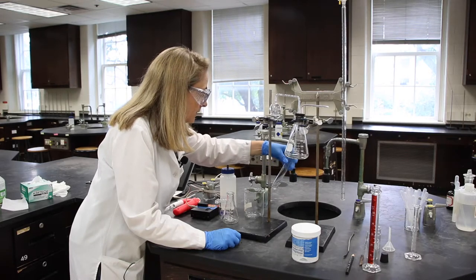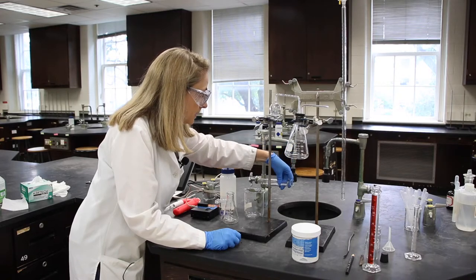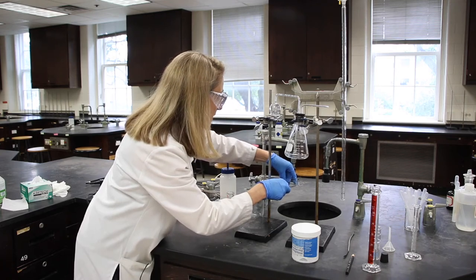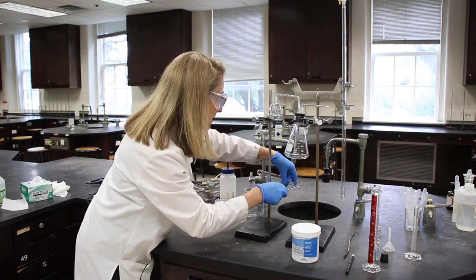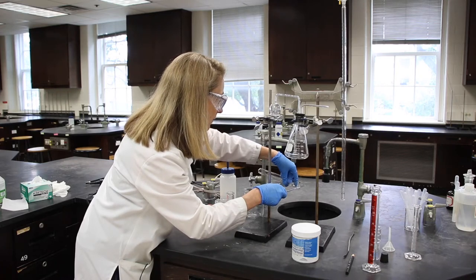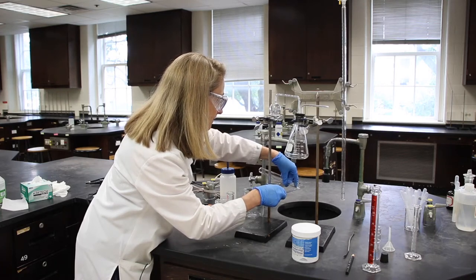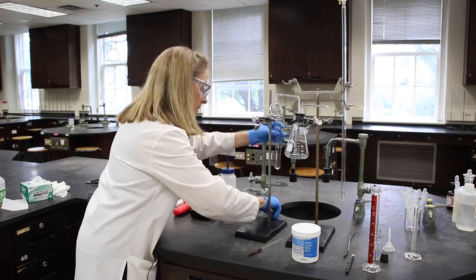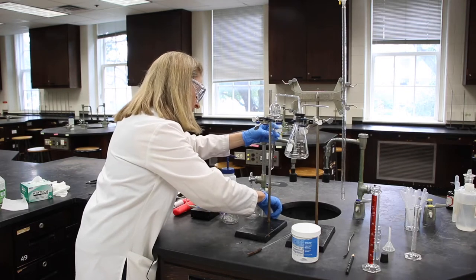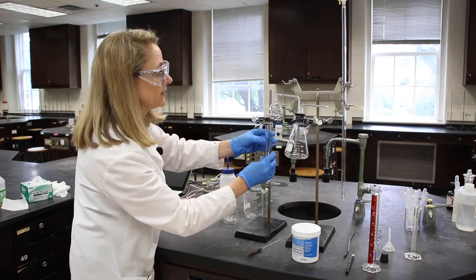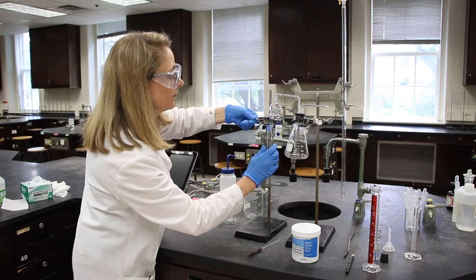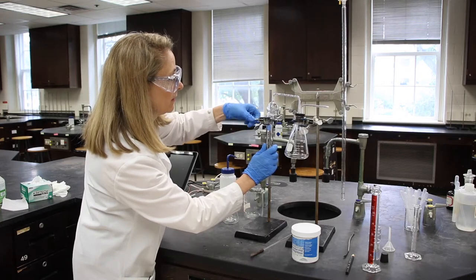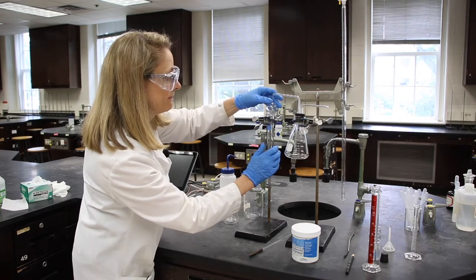You don't have to get all of the water out, but get most of it out. You can hold the boiling chips back in the test tube with a stirring rod. We lost one. And we can put it right back in. And we'll reassemble our apparatus.